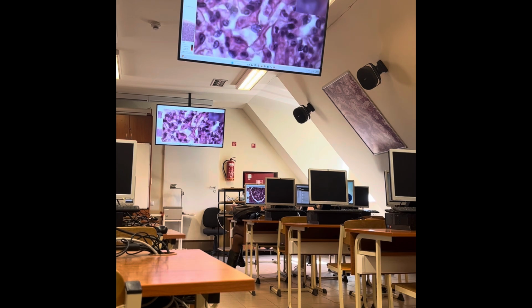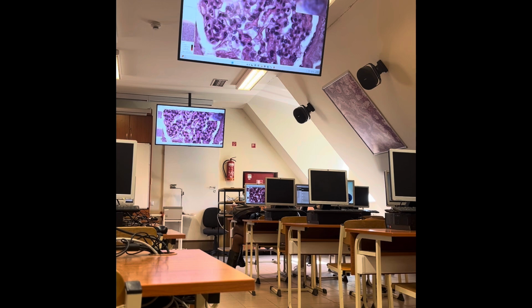This nucleus, for example, I think it's quite obviously a nucleus belonging to a podocyte, because that is larger than the surrounding cells' nuclei, and it is euchromatic. So podocyte, we don't see the processes which are nicely visible on electron microscopic images, but we can see the nucleus.